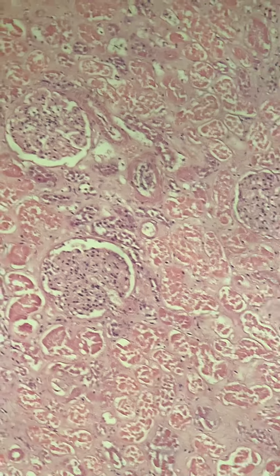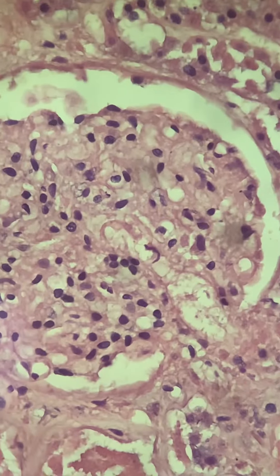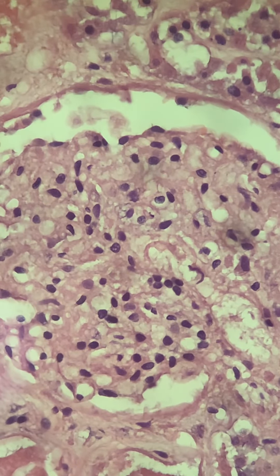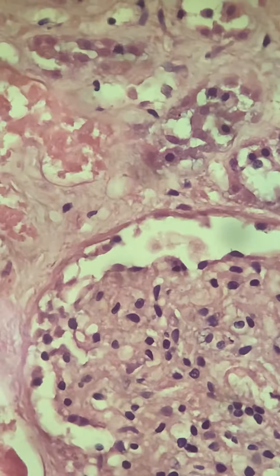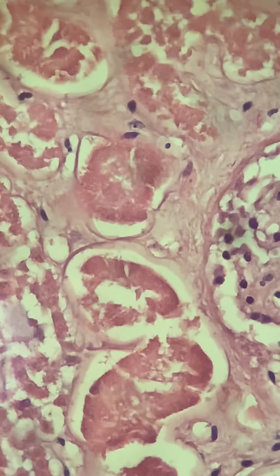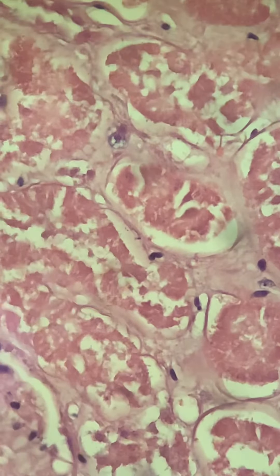I'm going to go down just to get a closer look and put a normal glomerulus right in view. Going down even closer so you can see up close — not in a textbook — this is what a glomerulus will look like. Relatively healthy, there's some slight mesangial cell proliferation, but relatively speaking this kidney is still functional — very much functional. And you can see the renal tubules are necrotic from low flow of blood from sepsis.